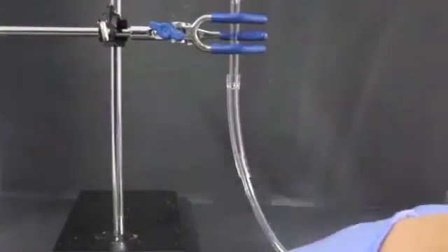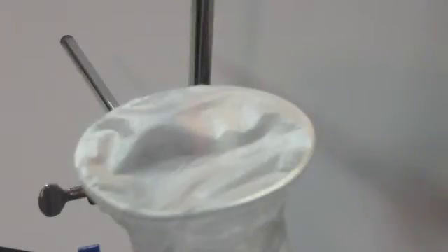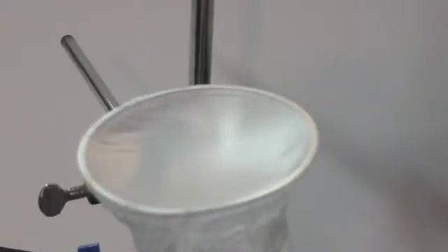Before moving on, you need to make sure that all of the connections are airtight. Do this by securing some plastic wrap to the funnel and pulling on the syringe. If it does not contort, you will need to check for leaks and/or use a larger syringe.